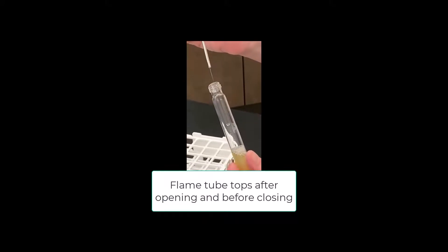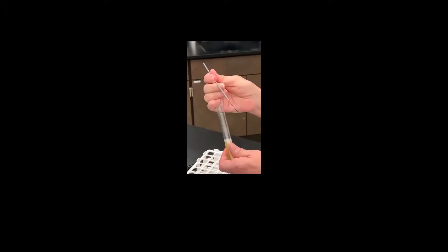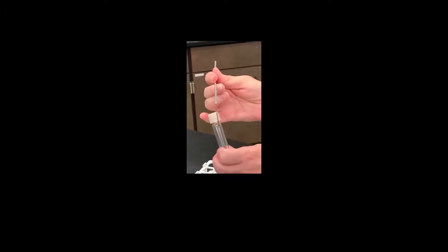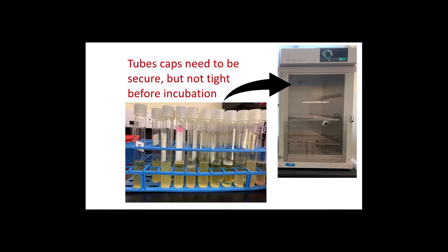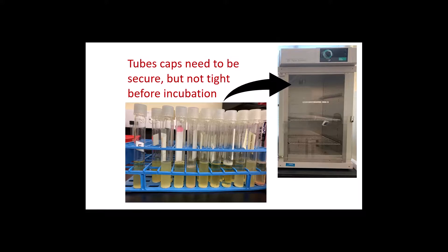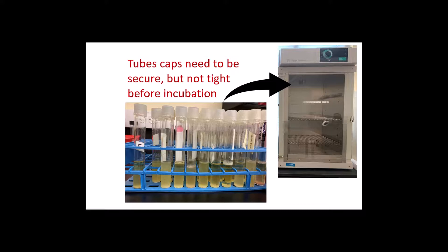The purpose of flaming is just to incinerate any contaminants that may be on the rim of the tube. If cotton or foam is used to stopper the tubes, this is a really important step. But if twist-on caps are used, this step may not be necessary, although it certainly doesn't hurt. When you're ready to incubate your tubes, tighten the cap and then go back one turn so that the cap is secured but not cranked on tight. This allows some air in. The exception to that is when you are working with anaerobic bacteria.